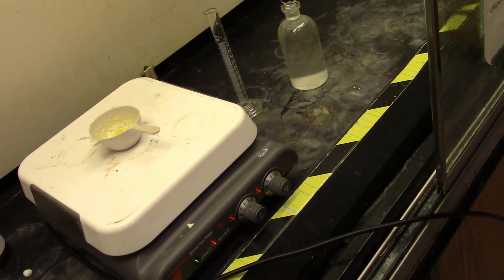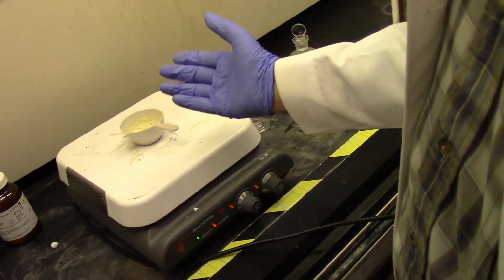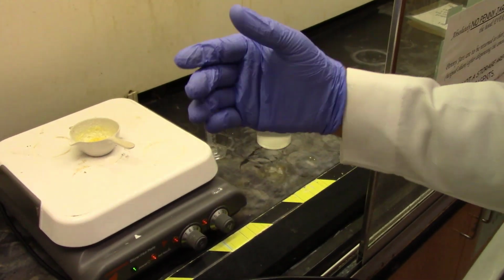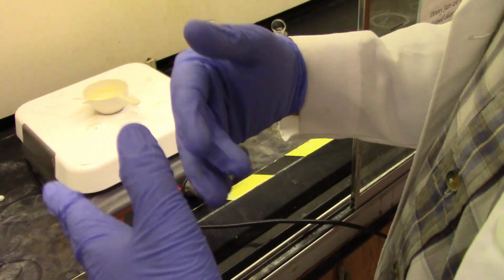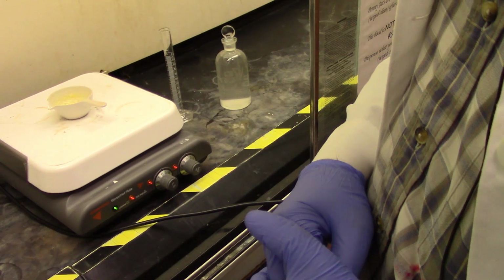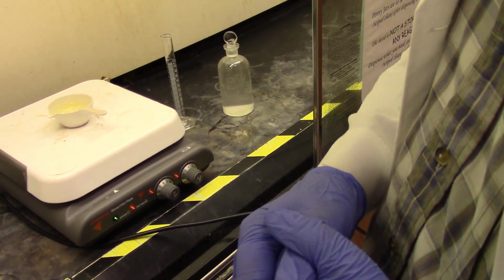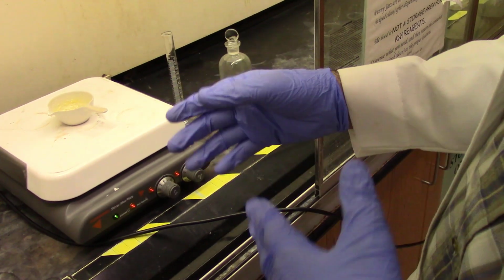Then I added 8 milliliters of methanol solvent, and again I stirred it with a glass rod to make a solution of it, and then I evaporated it again quickly on a hot plate. After that my reaction is done, and now I am going to do the workup. Remember, workup is the procedure by which you have completed the reaction and now you are trying to isolate the desired product, and that will be the next step.